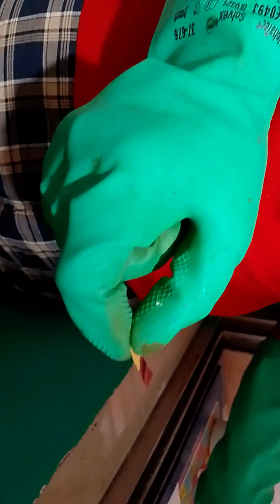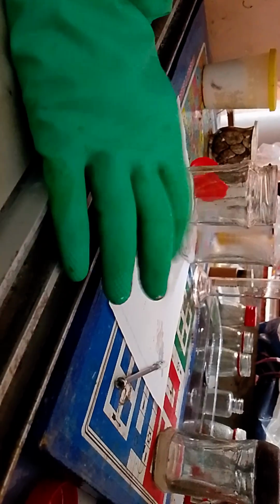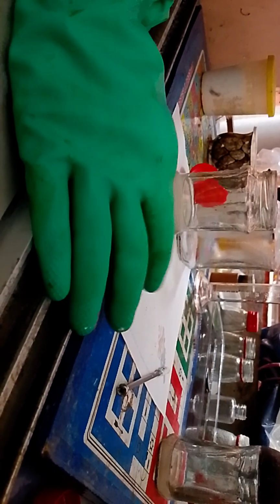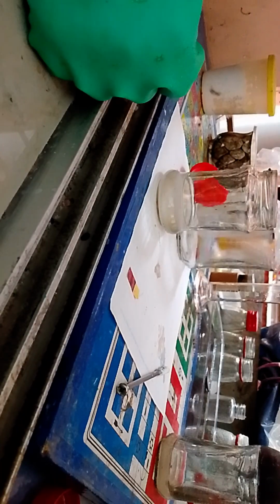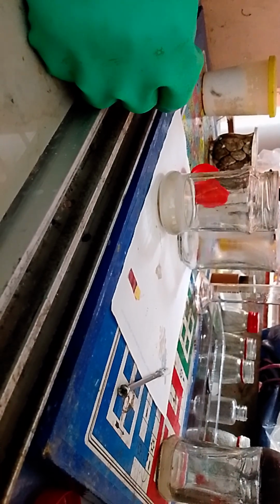Yes, that is definitely turning white up over here. We need to wait for a moment. It turned purple here. Sorry, not purple. It's like maroon, which means extremely acidic. Why? I can't understand. Boy, this one is making me freak out.